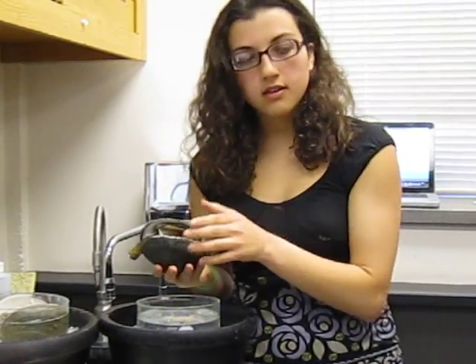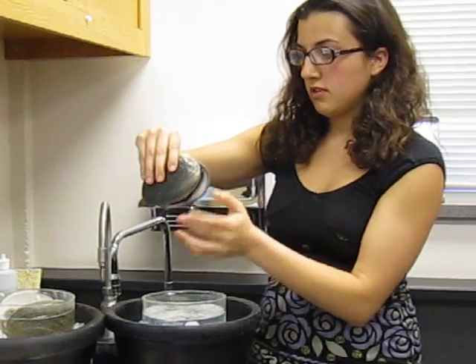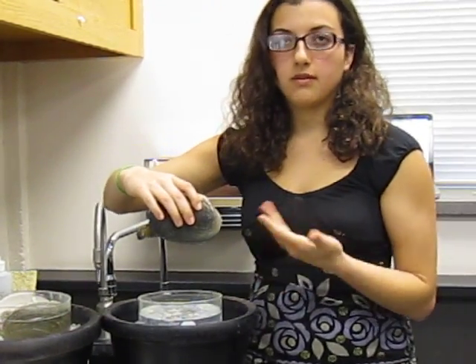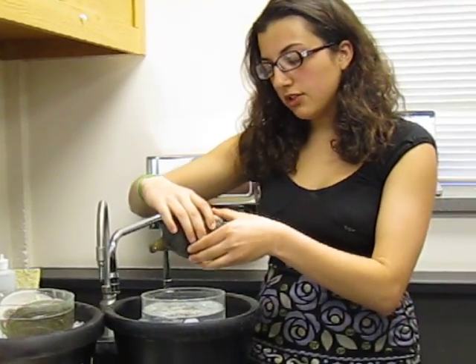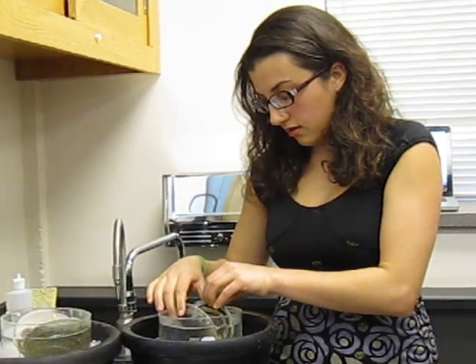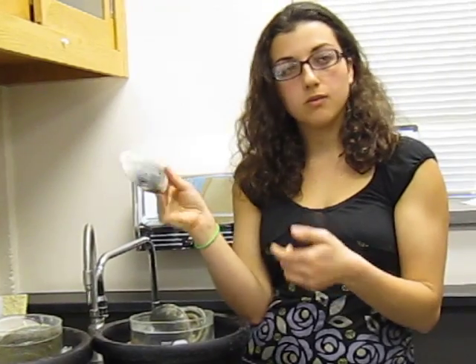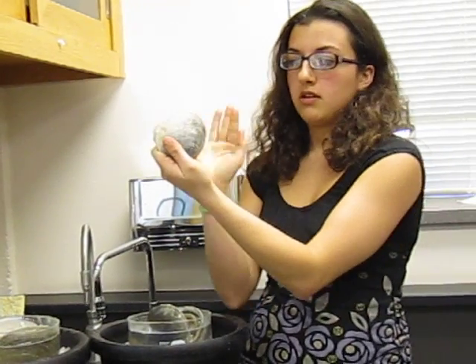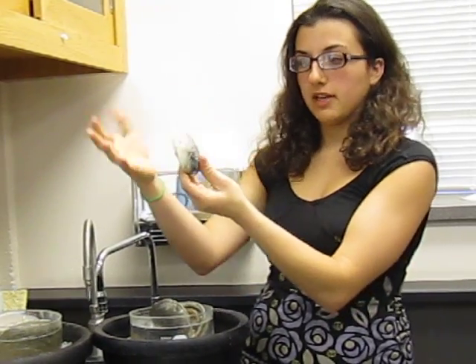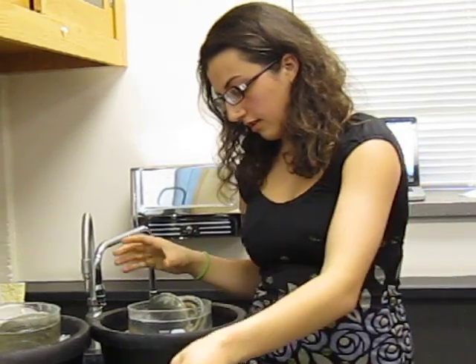All right. Can you say it again? Yeah. Dorsal, ventral, anterior, and posterior. You should be able to know based not only on this demo where you can see all the organs, but also on just a shell, what the shape is, posterior, anterior, dorsal, ventral. Most clam shells will look like this. Okay, so we got our shell.